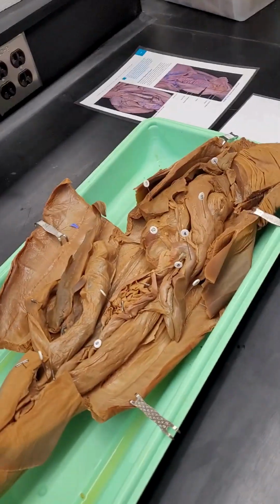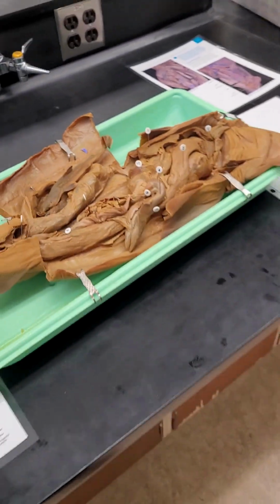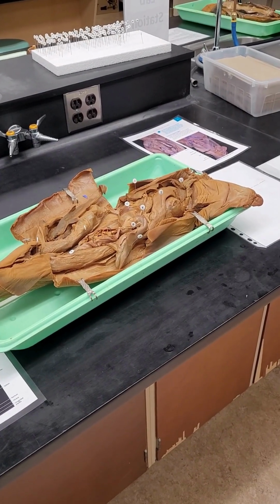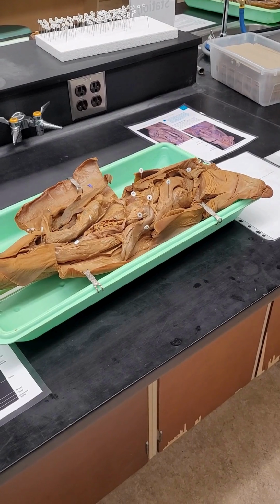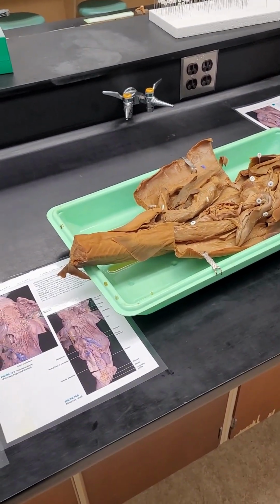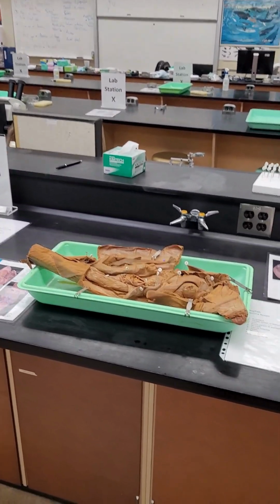What's amazing in this image, though, is that we can also see that this is a female, and it's not the emphasis of this lab, but you can see that this is a baby shark, a little baby shark, because this has one of the longest gestation periods of any vertebrate. It's ovoviviparous, so eggs are retained internally where they develop, and it gives birth to live young. So it's quite an astounding thing to see there. Up to 24 months gestation. And that's just a quirk of this particular individual. Kind of a shame, really. Hopefully we would prefer not to capture old females for labs.